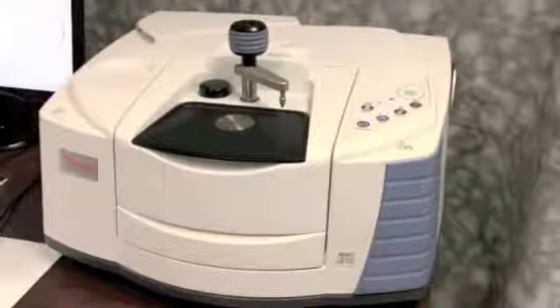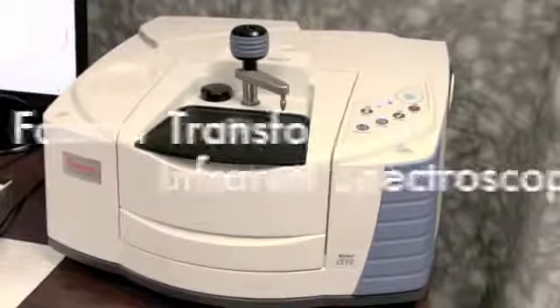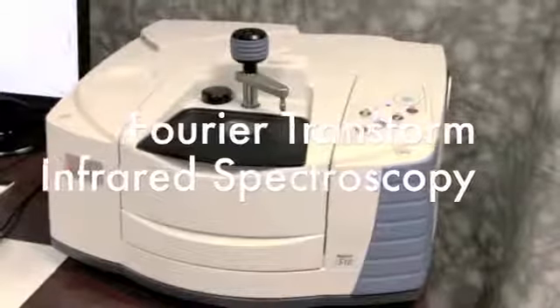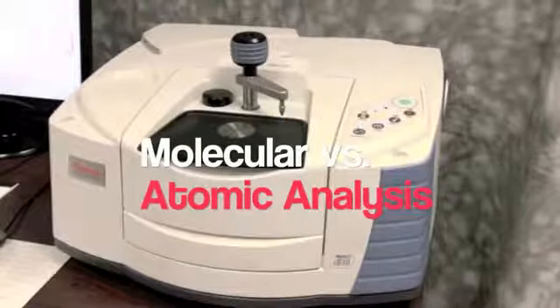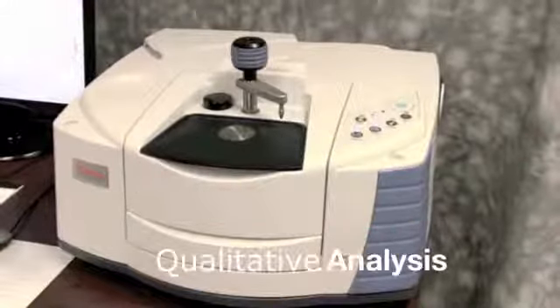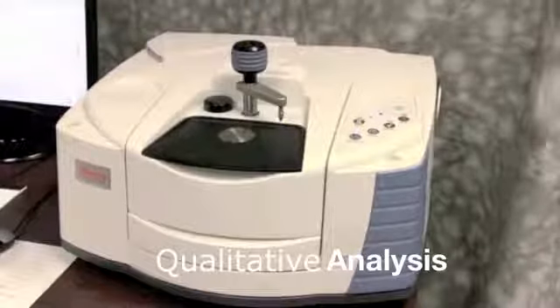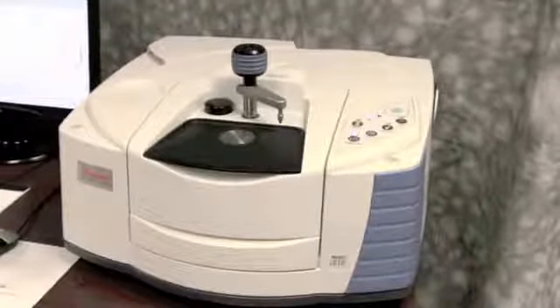We're going to talk about FT-IR analysis. FT-IR analysis is Fourier transform infrared spectroscopy. It's a molecular versus an atomic analysis, which means that we're going to look at the molecule and not at the individual atoms. It's qualitative versus quantitative. However, you can do quantitative analysis with it, but at laboratory testing, we simply do qualitative.